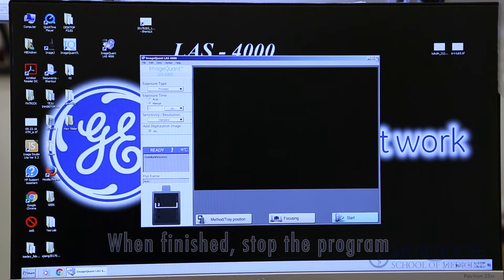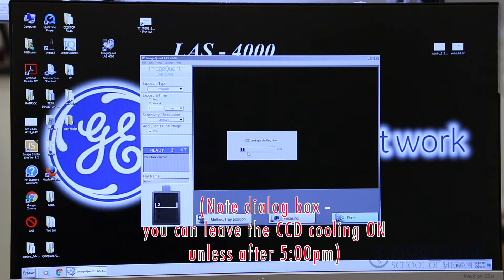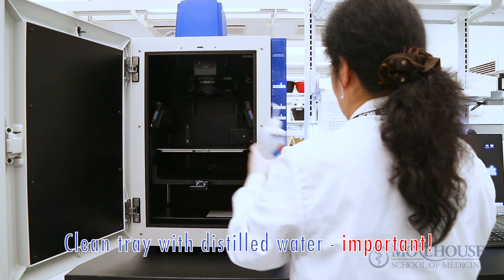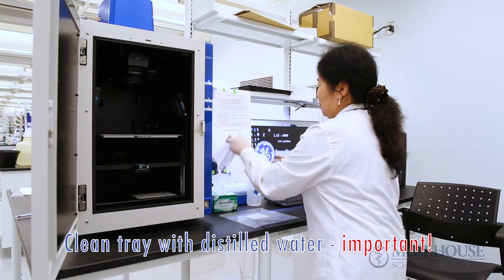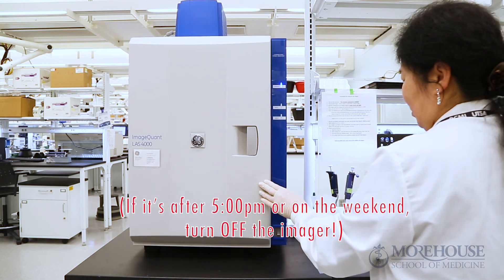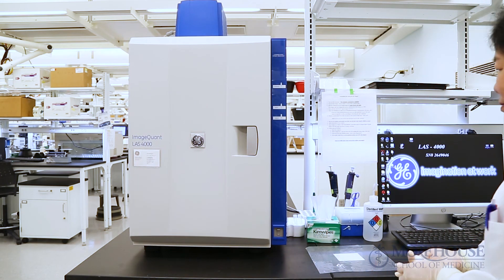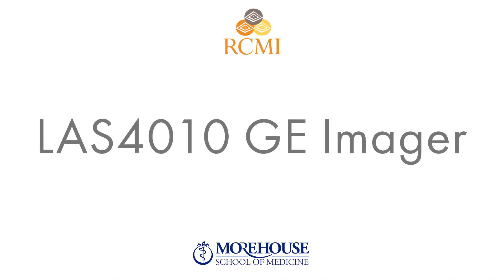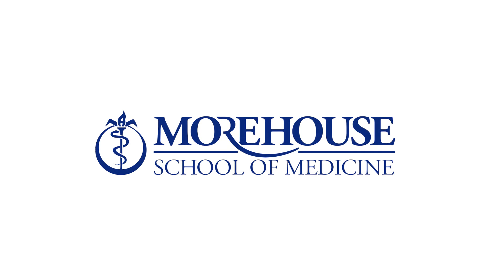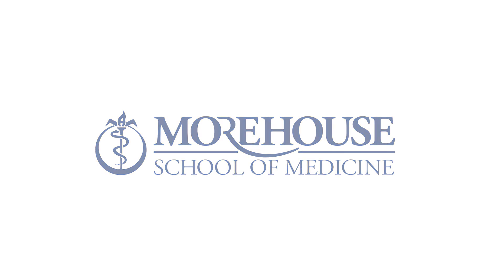When you are finished, stop the program. Note the dialog box. You can leave the CCD cooling on unless it is after 5pm. Clean the tray with distilled water — this is very important. If it is after 5pm or on the weekend, please turn off the Imager. You can also learn further from the document.